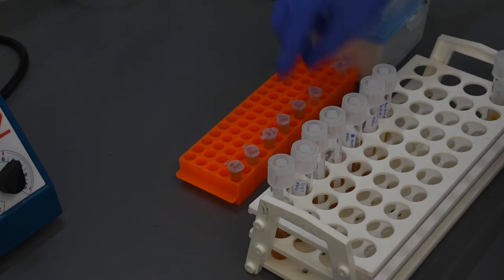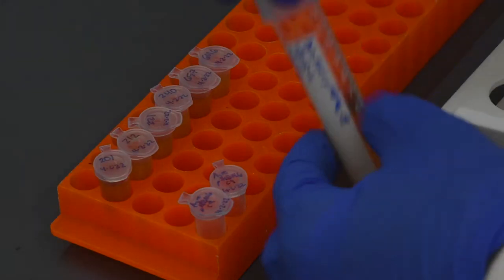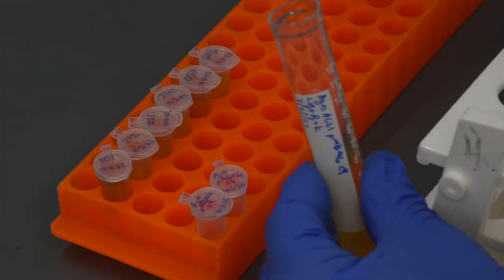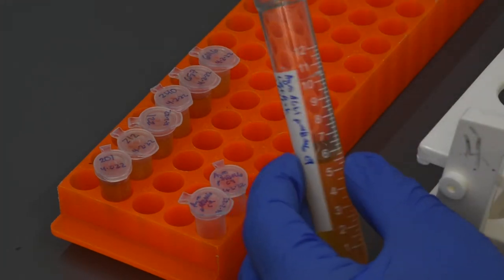If you need more agro than the yeast, you can use more tubes for the agro or run the same tubes multiple times while pouring off the cleared broth in between.